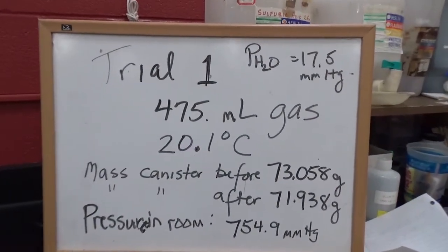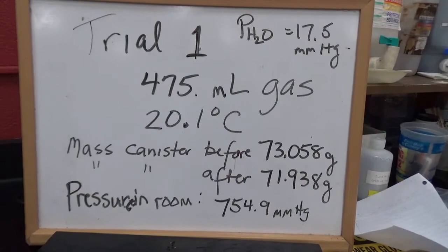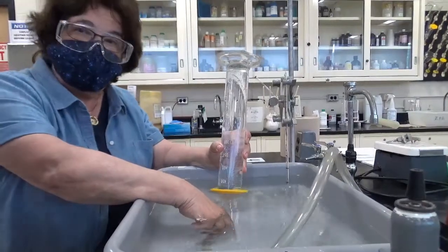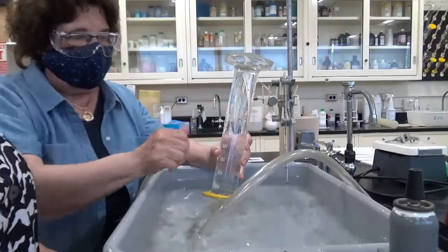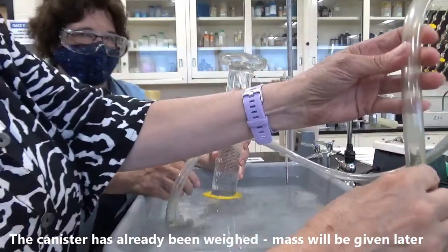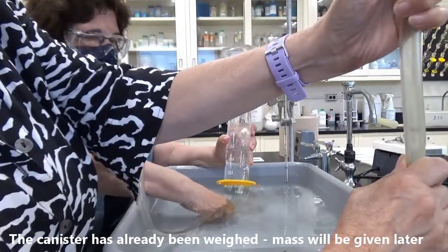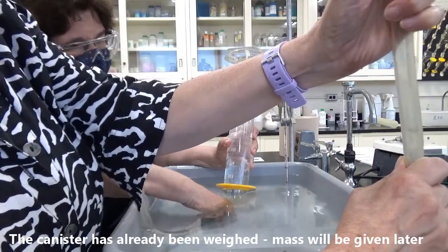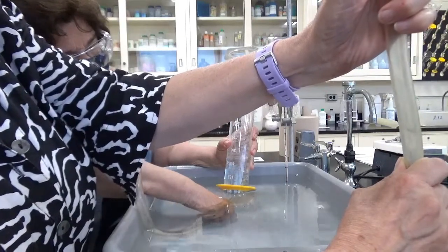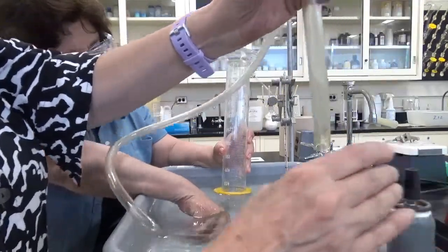So here's the data we collected for trial 1 of this part 2 of the lab. That's our data. For trial 2, we're going to do the same experiment again. We're going to put the tubing inside the graduated cylinder that's filled with water, and push down on the tubing. We're going to get some of this gas in here. Here we go. Tell me when to stop. Not quite, a little bit more. That's it. We don't want to get too much gas in here.